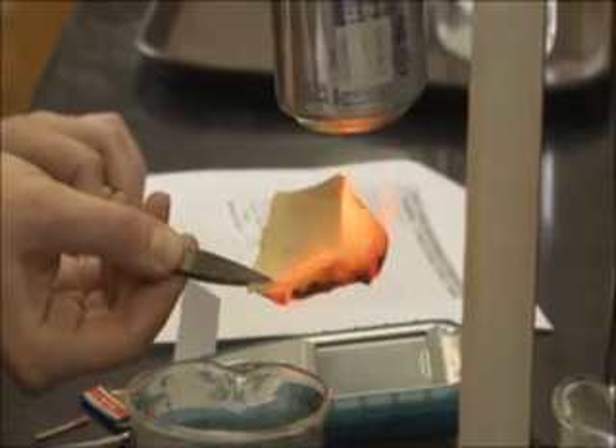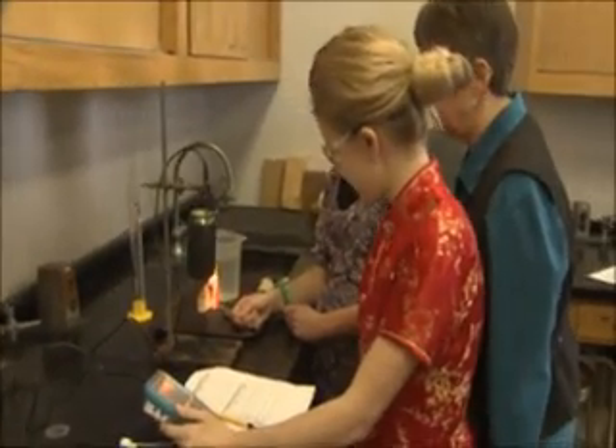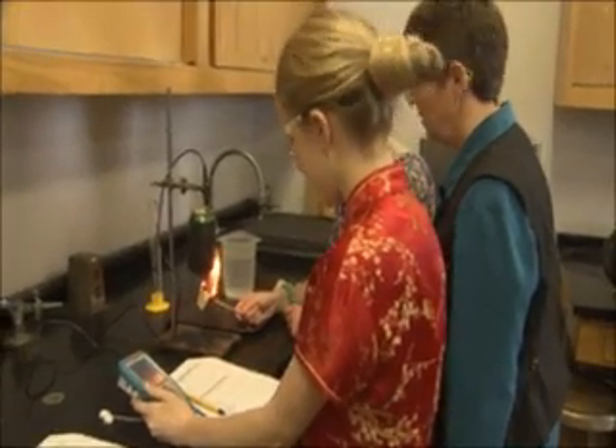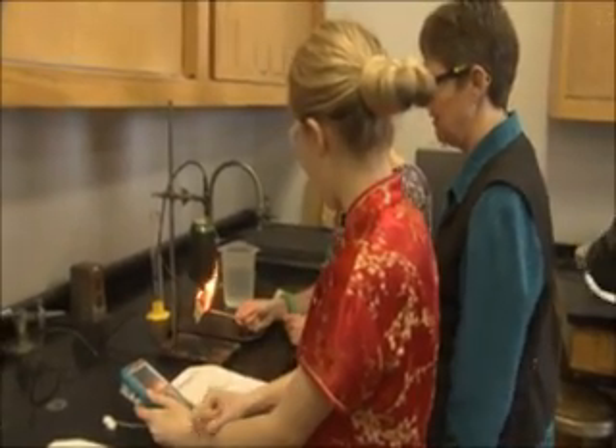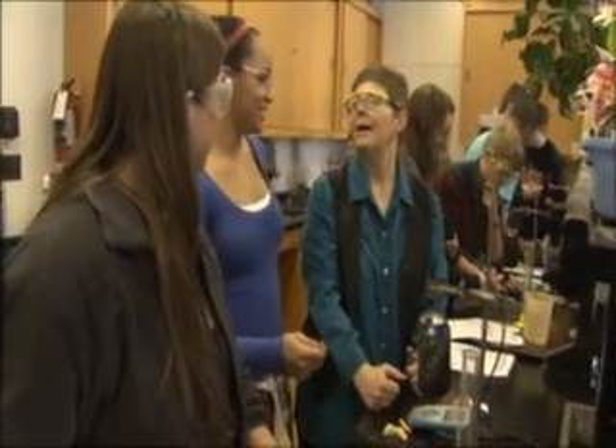So I would like someone — you should burn at least three or four foods. Blow it out. Which one is this? Baked. Hold it right under. Very good. And she freaked out and put it in the water.